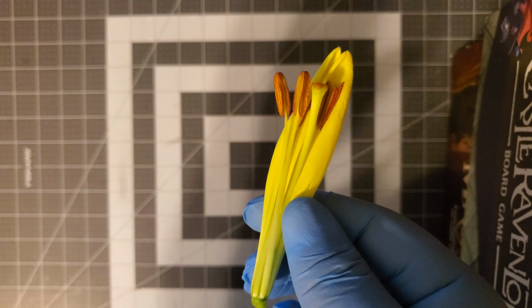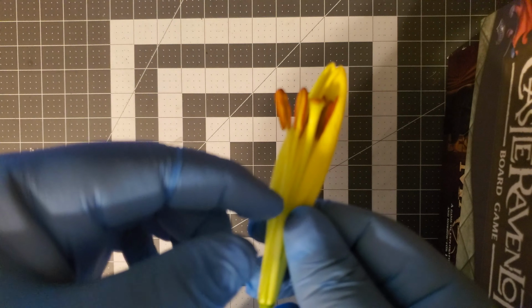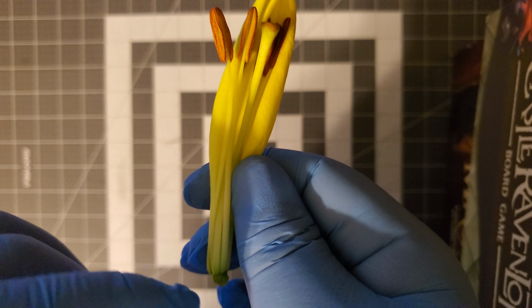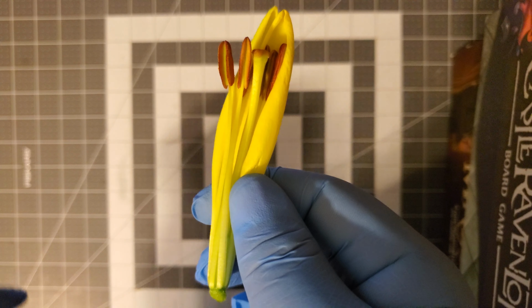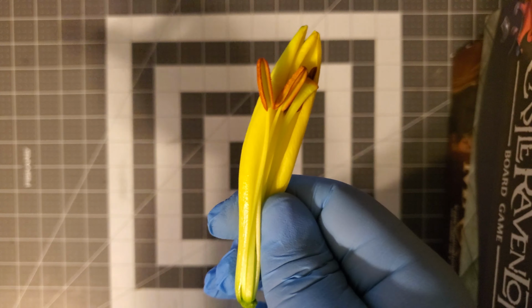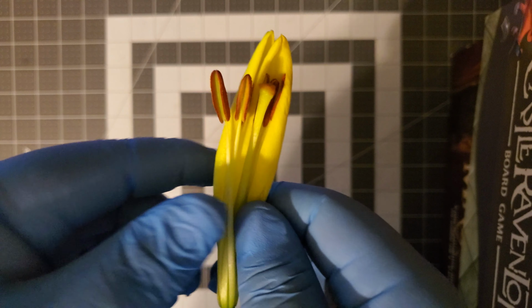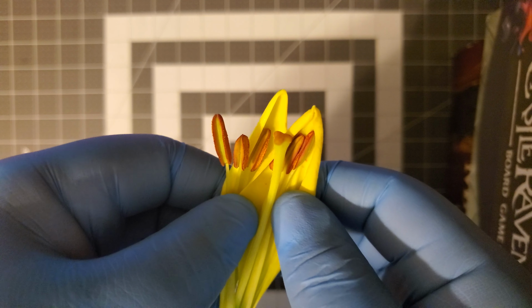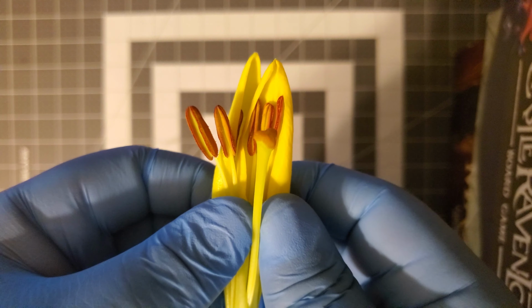So the inside has very defined, very visible stamens. You can definitely see the filament going up and the anther being quite visible, almost like the model you had shown. However, the one thing that we didn't see in the red flower, we do see right here, which I would definitely believe is the pistil.